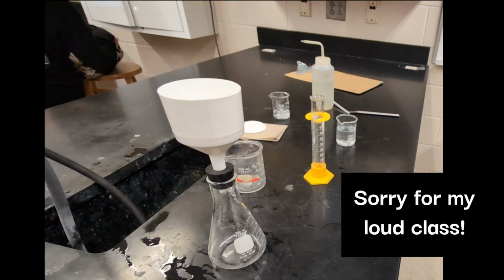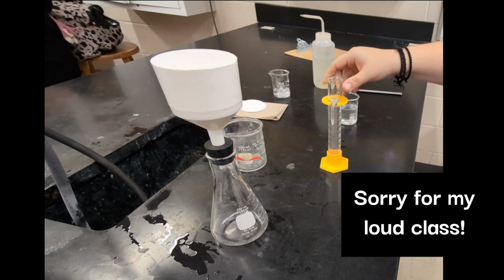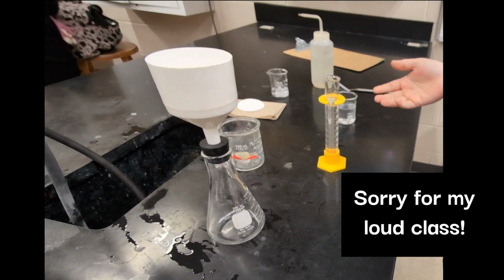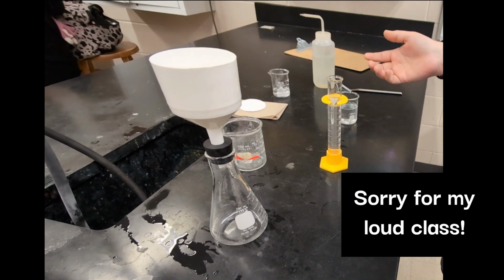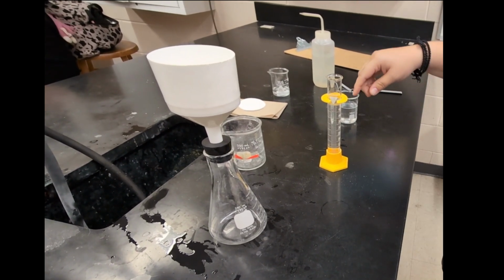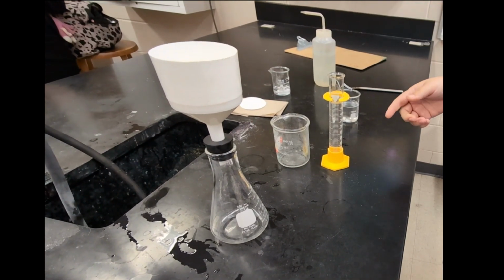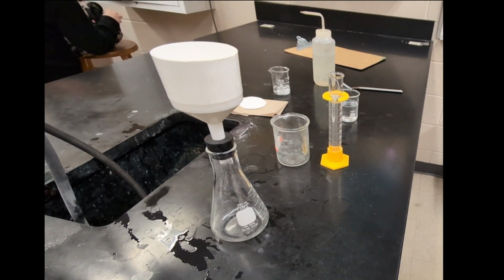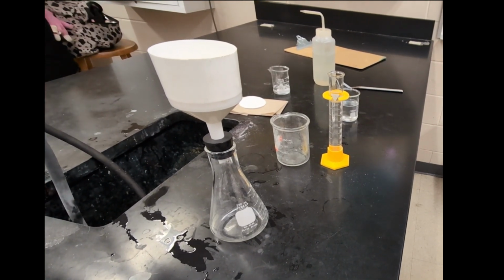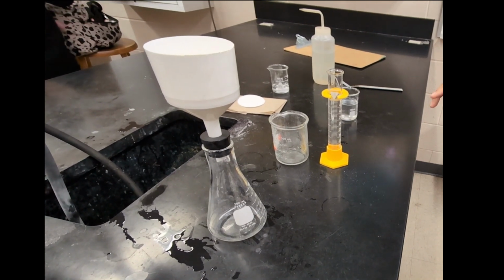Okay, so for the experiment part of this, I have 50 milliliters of our unknown calcium ion solution. It's going to simulate our hard water solution, but it doesn't matter exactly how much calcium chloride you put in there, because it's just simulating a sample that you got from wherever you're taking your water sample, whatever city or location around the county.